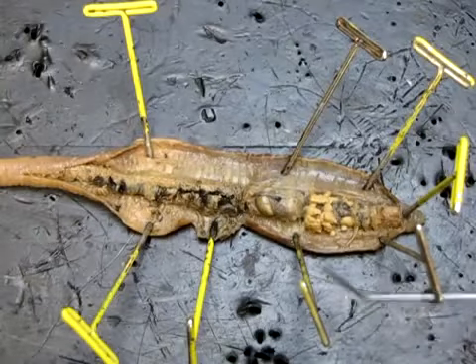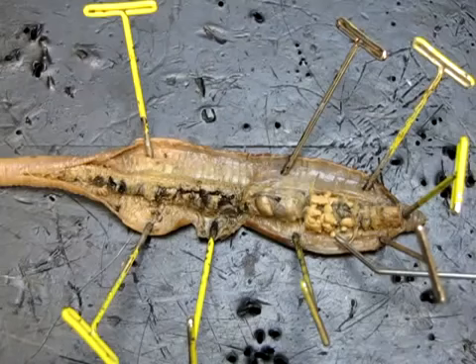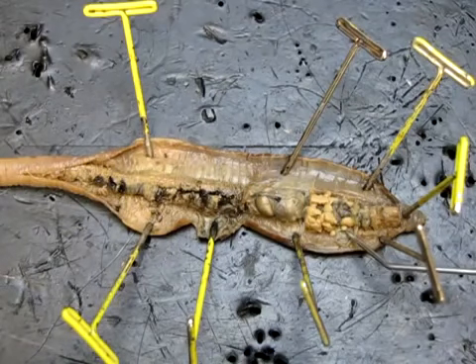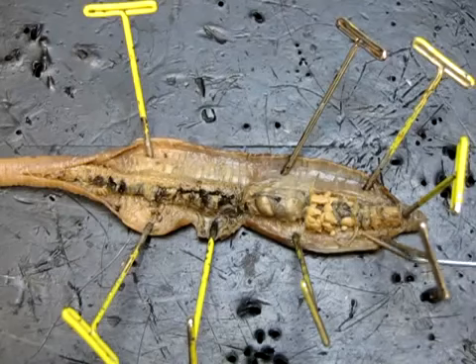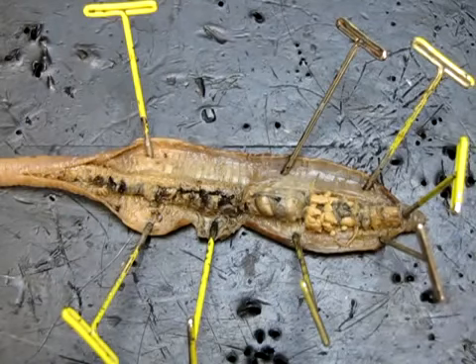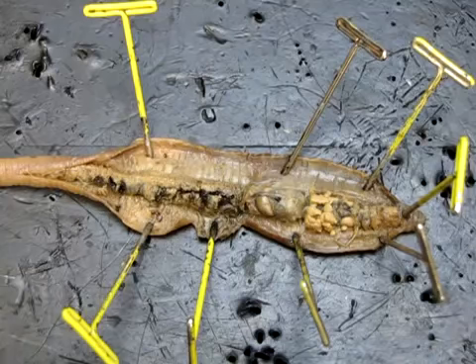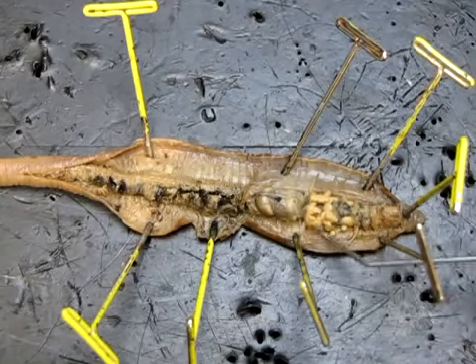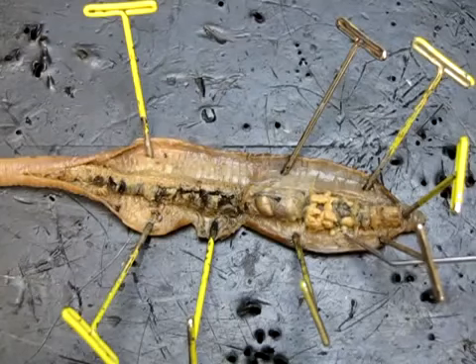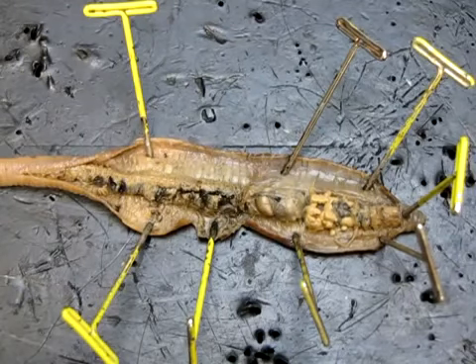And then if we look to one side, just below, you'll notice a very small round lobe right here, and another very small round lobe right here. Those are female reproductive organs, and those are called seminal receptacles. So those actually hold sperm after cross-fertilization has occurred. So you will, of course, note, because we have male and female organs, that this animal is monoecious or hermaphroditic, but they do mate with another individual to cross-fertilize. Okay, so both male and female organs. There are other structures involved, but they are difficult to see, so we'll leave them out for now. But understand that we can see the two there.